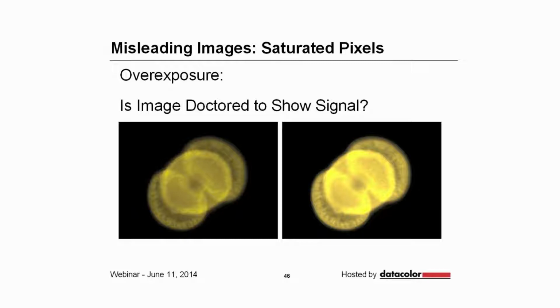You always acquire your image so that you can see all of the significant areas of the brightest parts of your image, and immediately when you see things brighten like this, you think to yourself, oh yeah, they want me to think that they got lots of staining. But this is not appropriate, absolutely not appropriate.